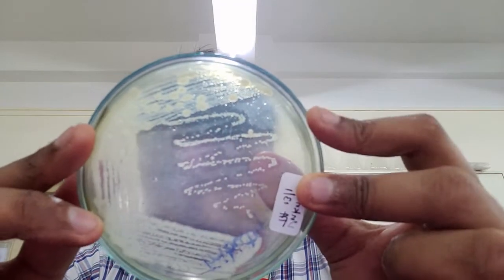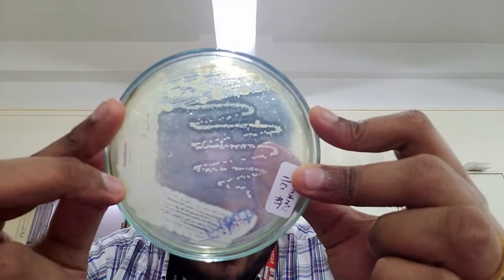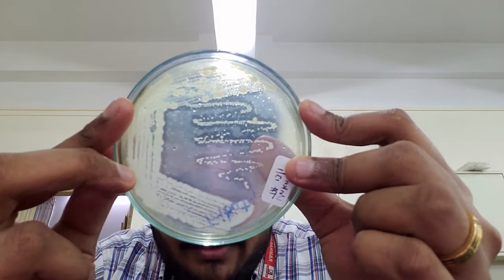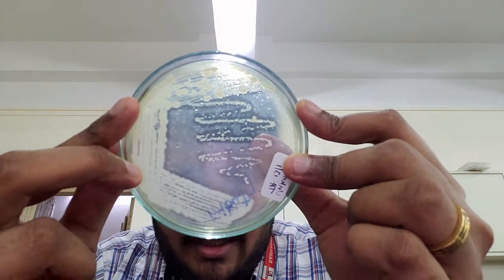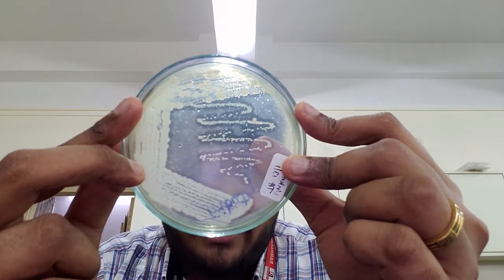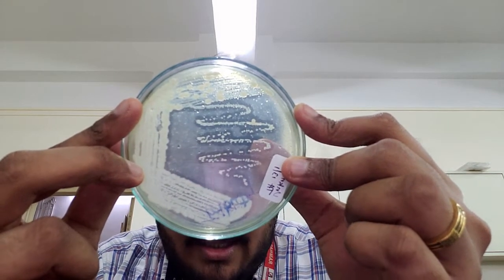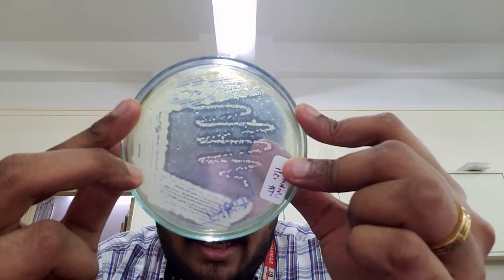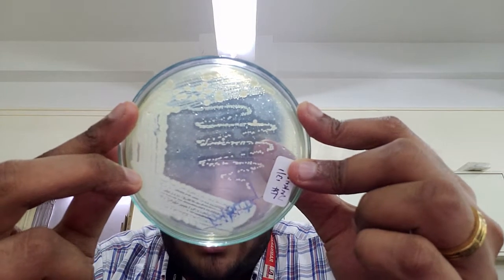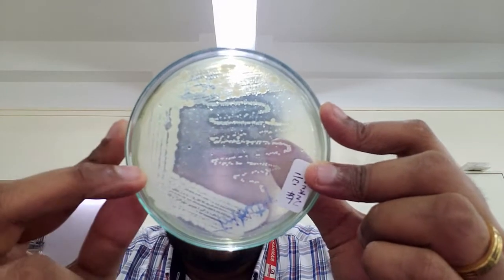I'll show you how evident clearance looks. If you look at this plate, you can very evidently see the clearance around the colonies. Wherever the streak is, you can see there is a lot of clearance around it, and it is very evident that this is indeed a lipase producer.